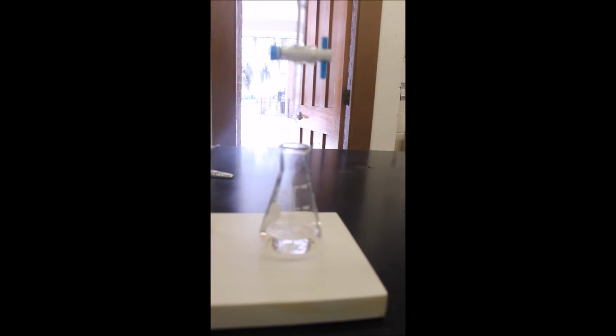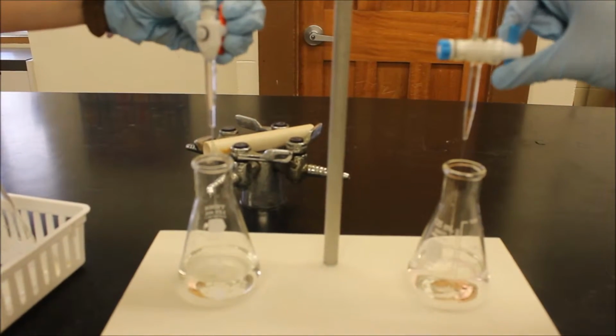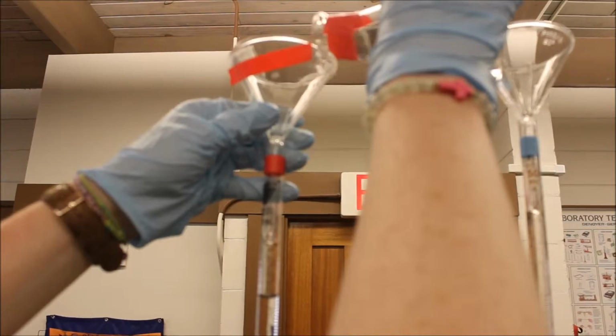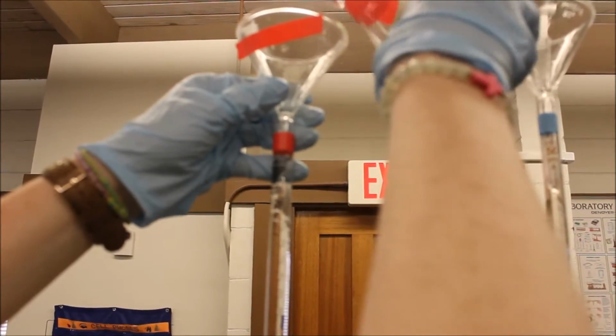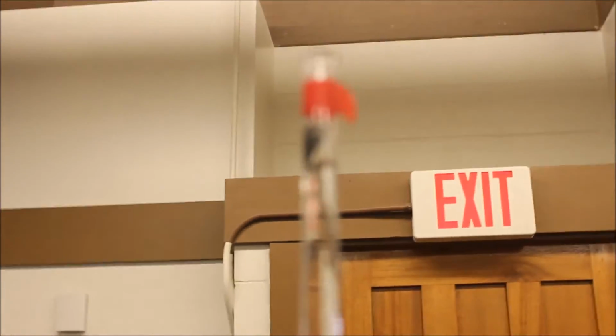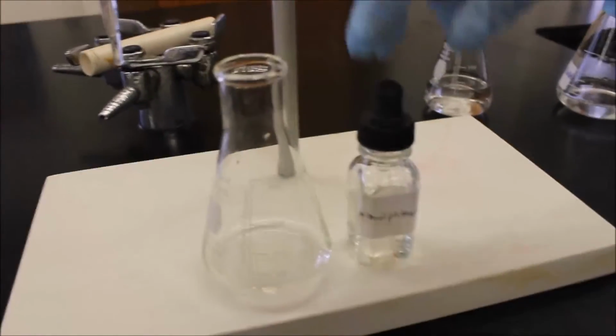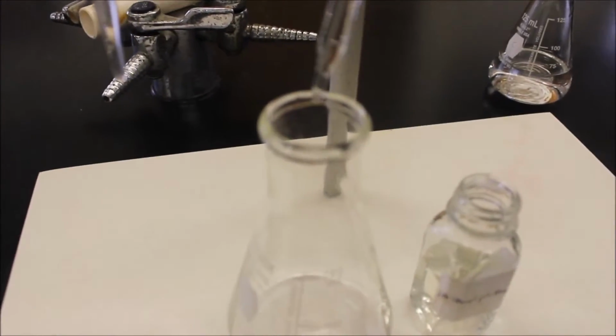The volume of acid in the burette was recorded to the nearest 100th milliliter as the initial volume. The volume was taken at the bottom of the meniscus. The volume of acid that was determined flowed into a clean Erlenmeyer flask. The initial volume reading on the burette was subtracted from the final volume. This was the exact volume of the acid released into the flask. The measurement was reported to the nearest 100th milliliter. 3 drops of phenolphthalein were added to this flask.